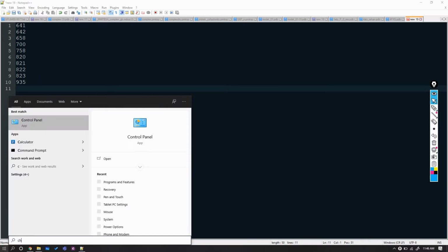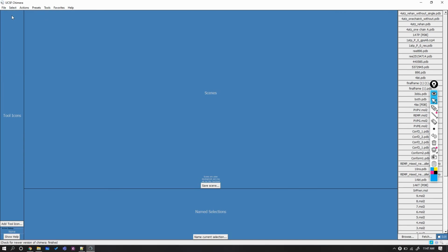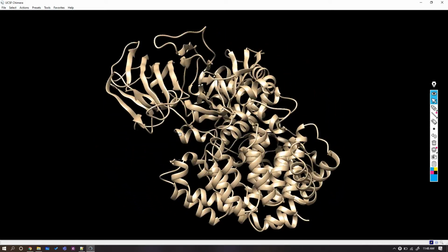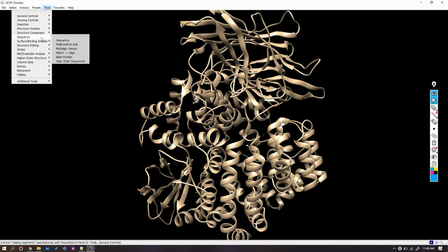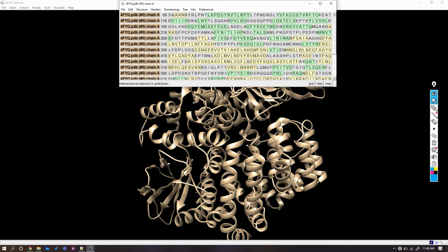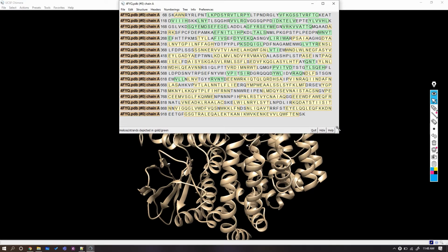Let's open UCSF Chimera. Let's fast forward it as well. Open the PDB file downloaded earlier. Here's the structure, actually a cartoon of the structure. It is a representation style. Click on Tools, Sequence, and again Sequence. It will open a new window containing the sequence of the protein. Let's make the window a little bigger.